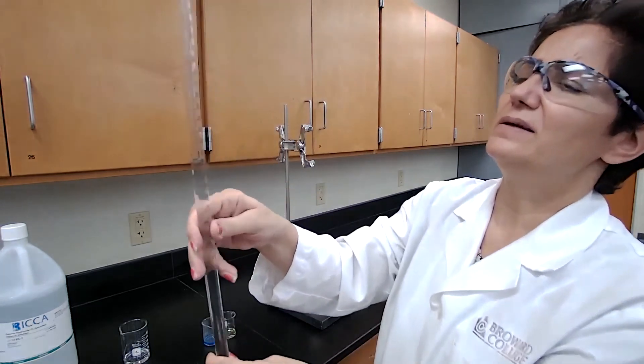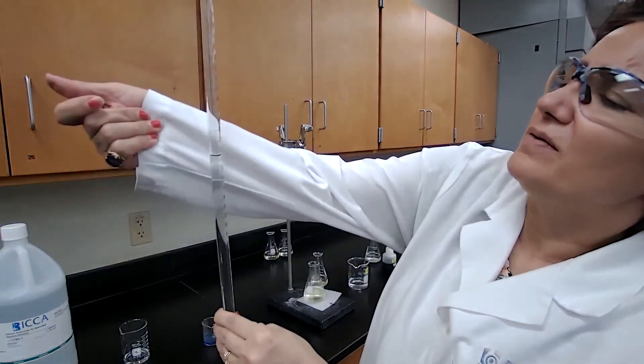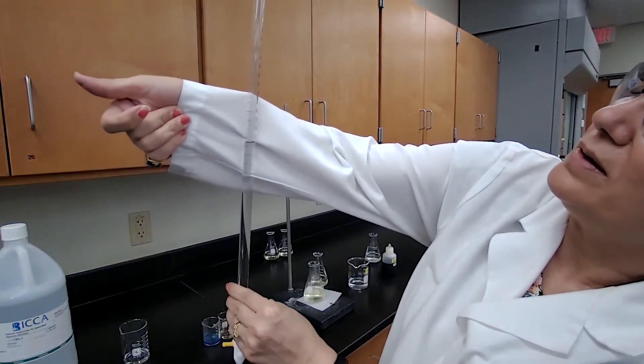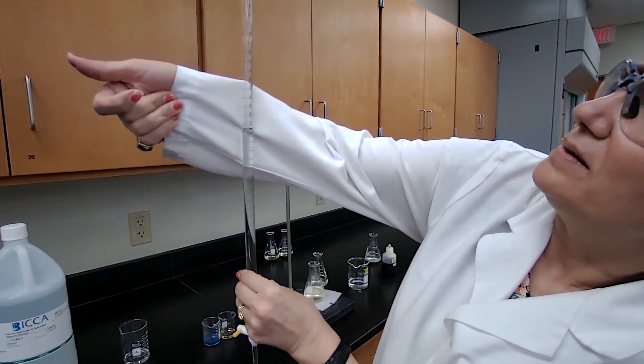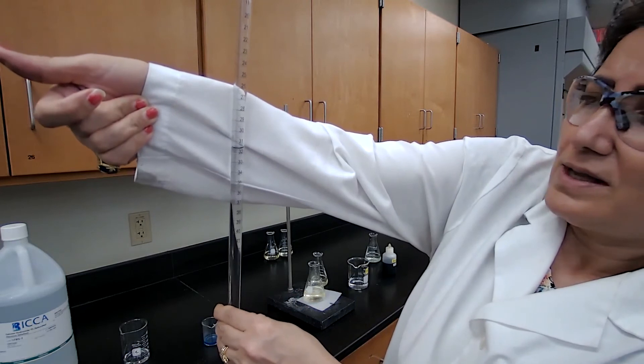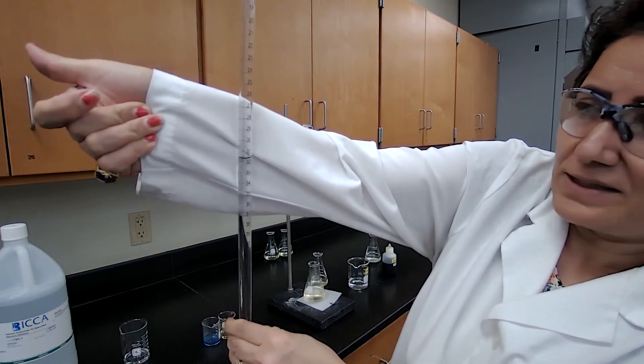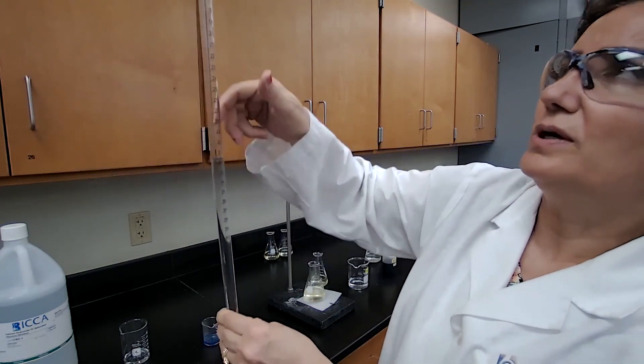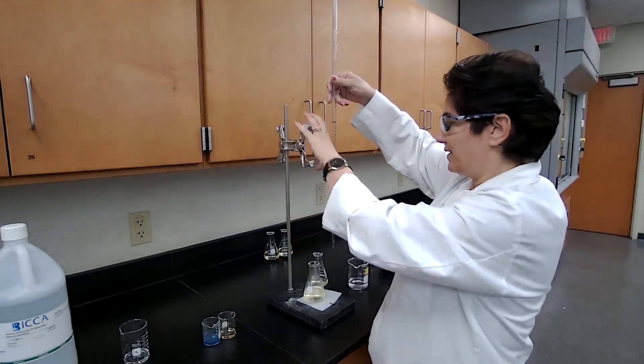We read the burette reading again. And this time we have 31.70, 31.70. And that would be the final burette reading for trial two of part B of the experiment.